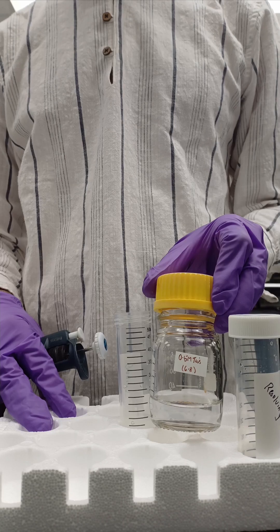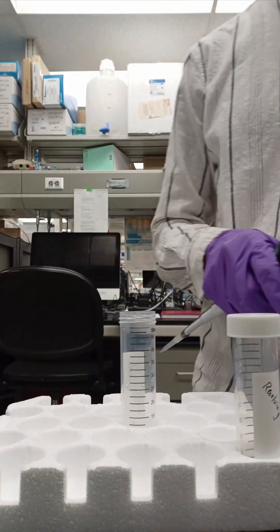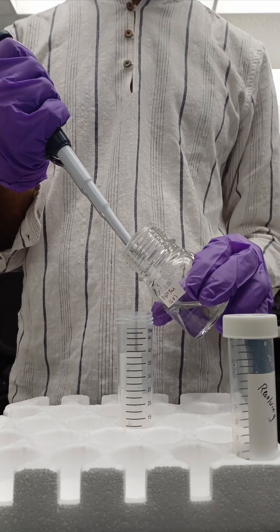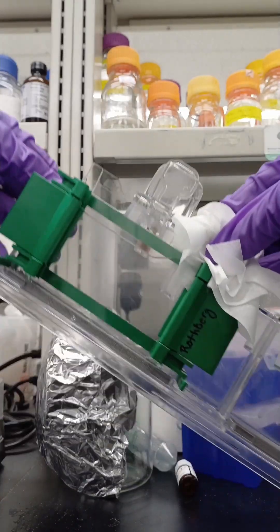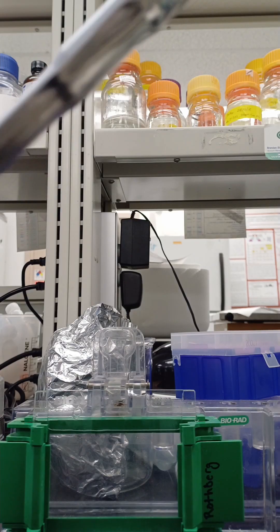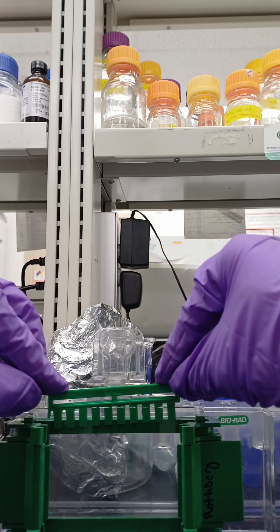Wait for 30 minutes while you prepare the stacking gel. For stacking gel, the ingredients remain the same except swap the tris with 0.5 molar tris of pH 6.8. Remove the water, pour the stacking gel and insert the comb at a slight angle to avoid bubbles.